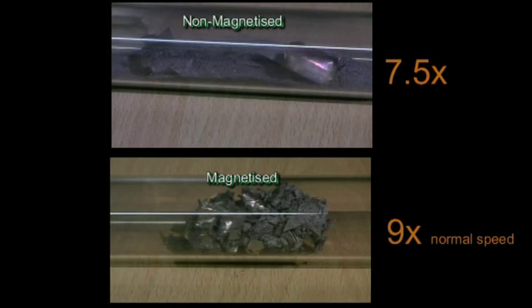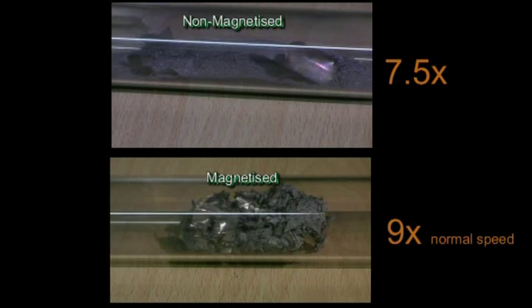From this video, it appears that the non-magnetised magnet is hydriding at a faster rate than the magnetised magnet.